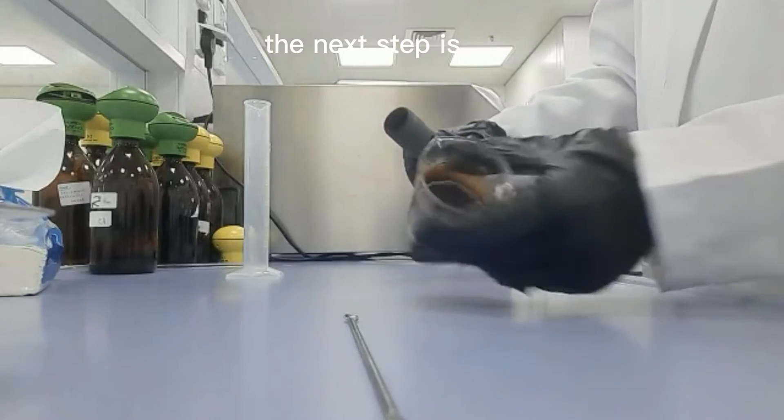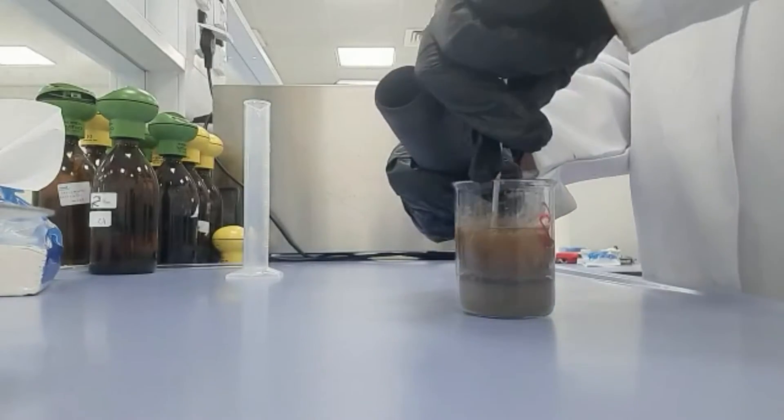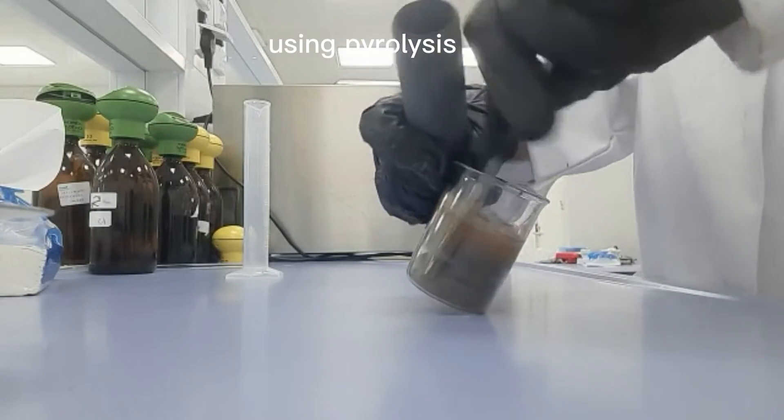The next step is to transfer the mixture into stainless steel tubes for the production of magnetic biochar using pyrolysis technique.